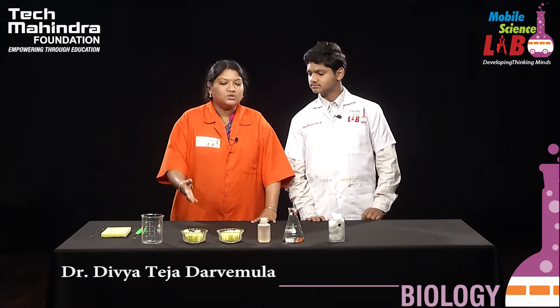We think microorganisms are always harmful, but there are many microorganisms which help us in many ways. Can you give me some examples? The microorganisms are bacteria and fungi. Very good. So the microorganisms we are using today are also bacteria and fungi.